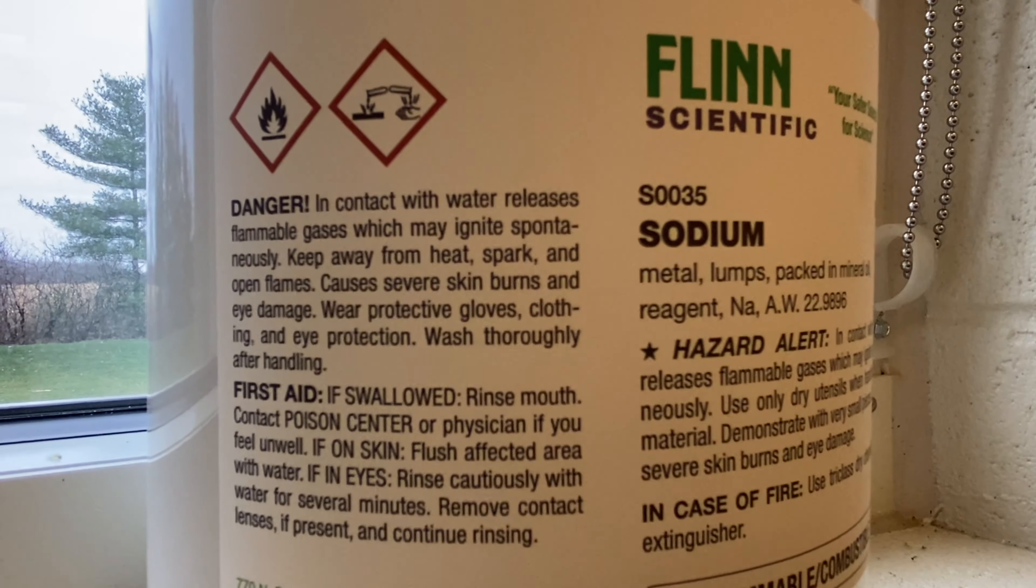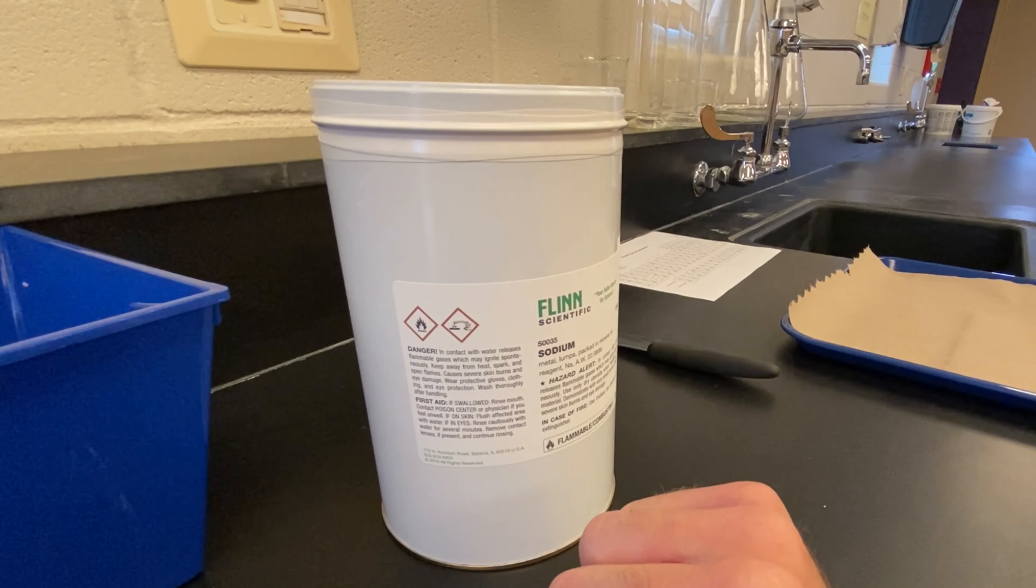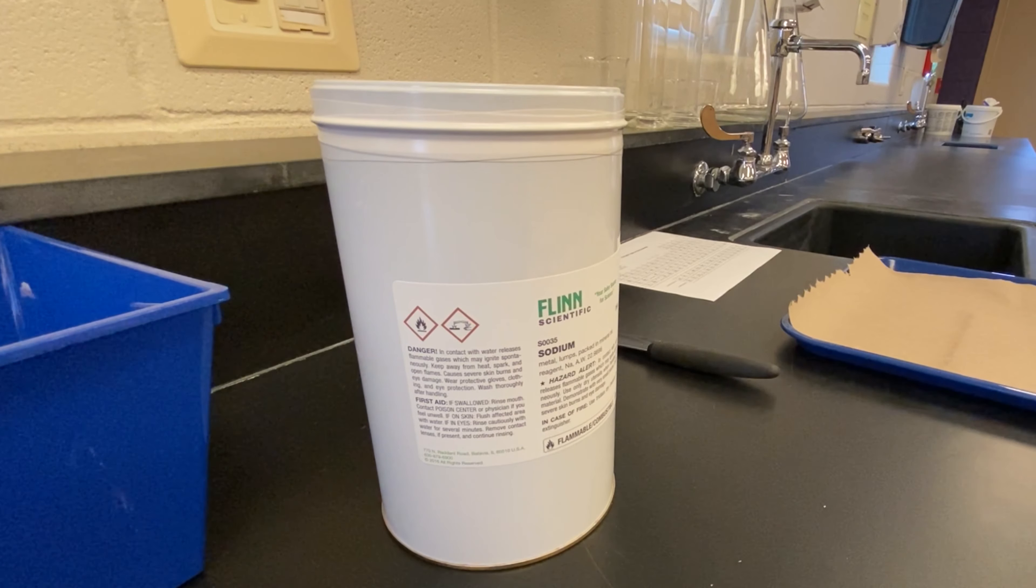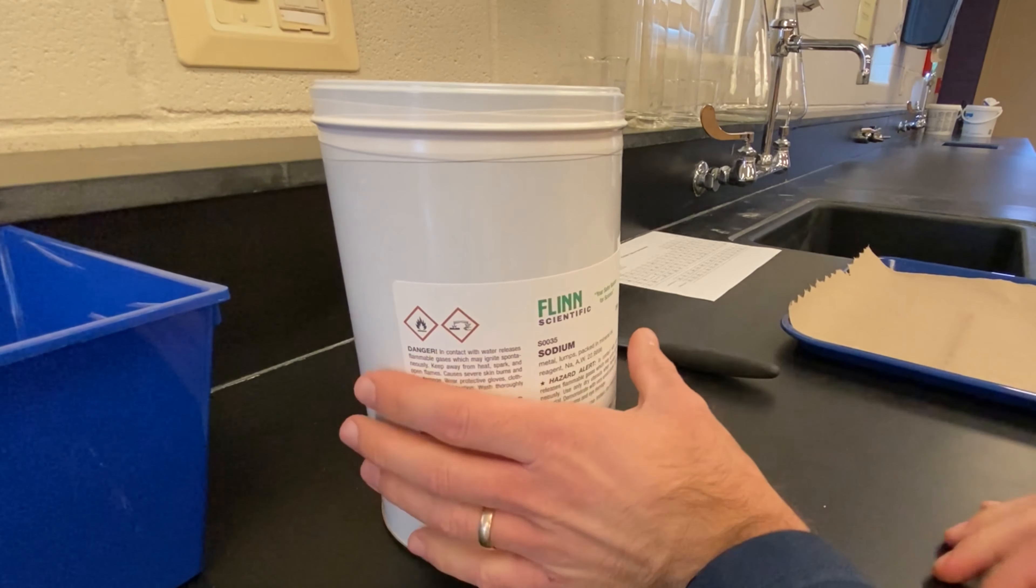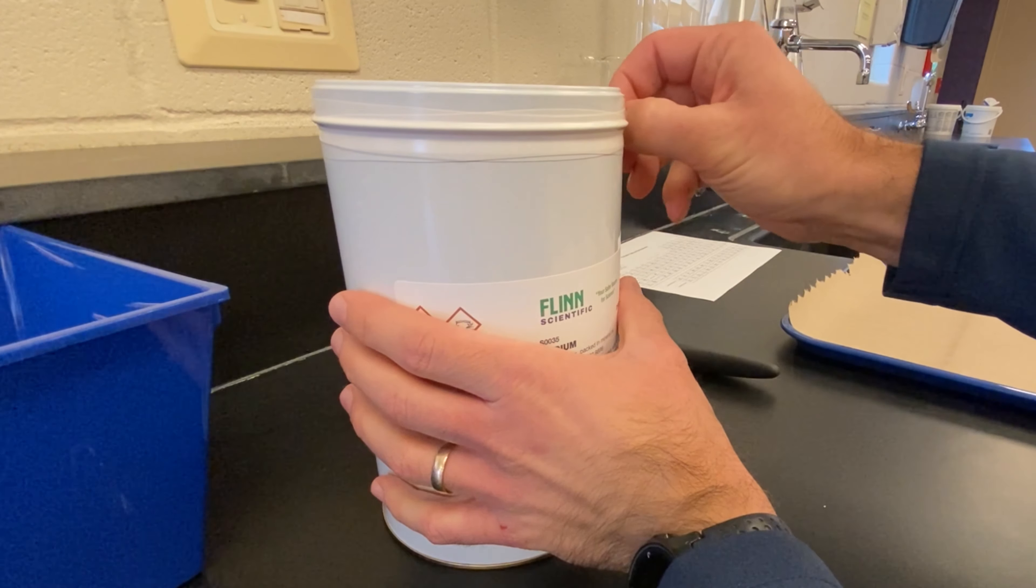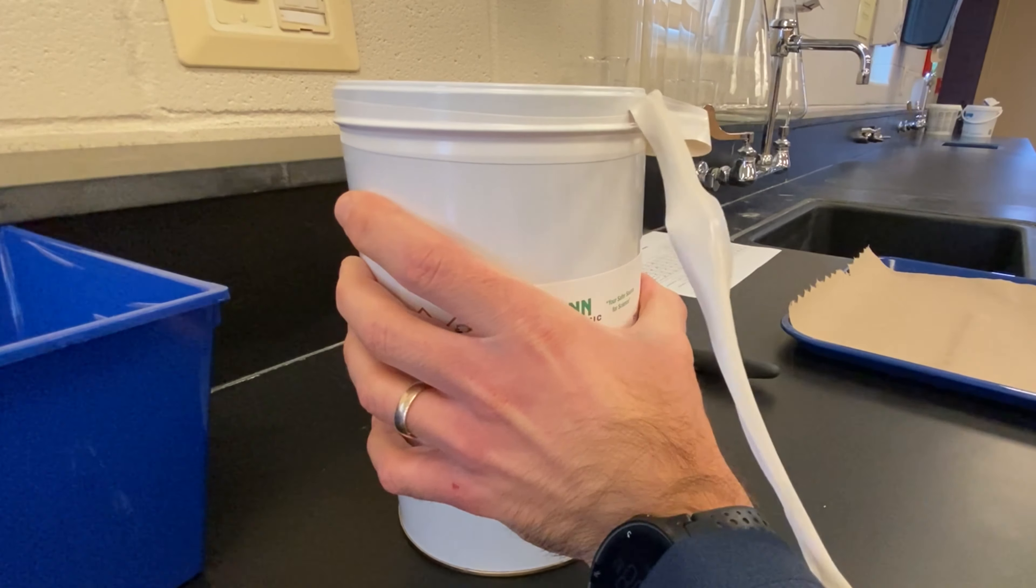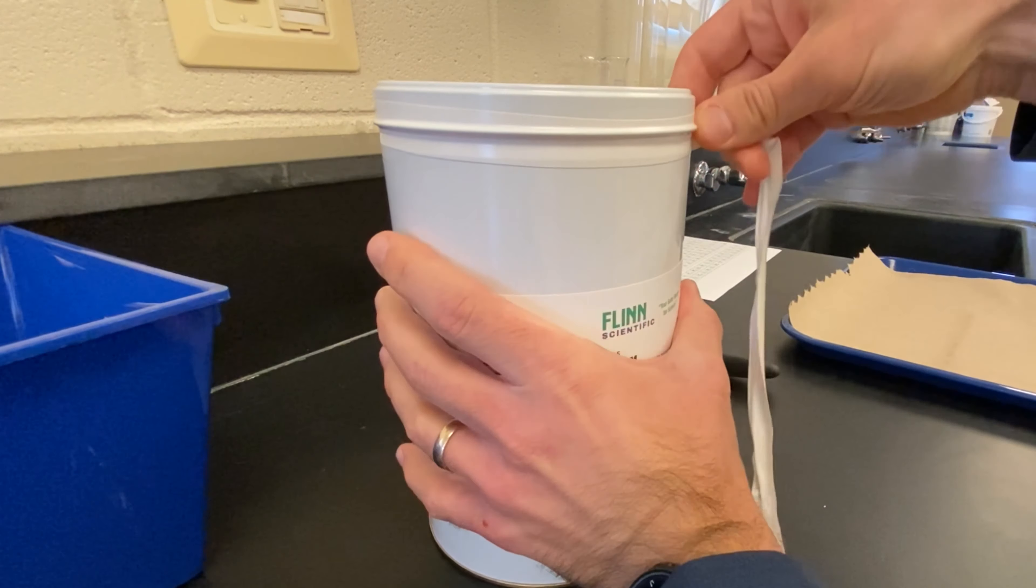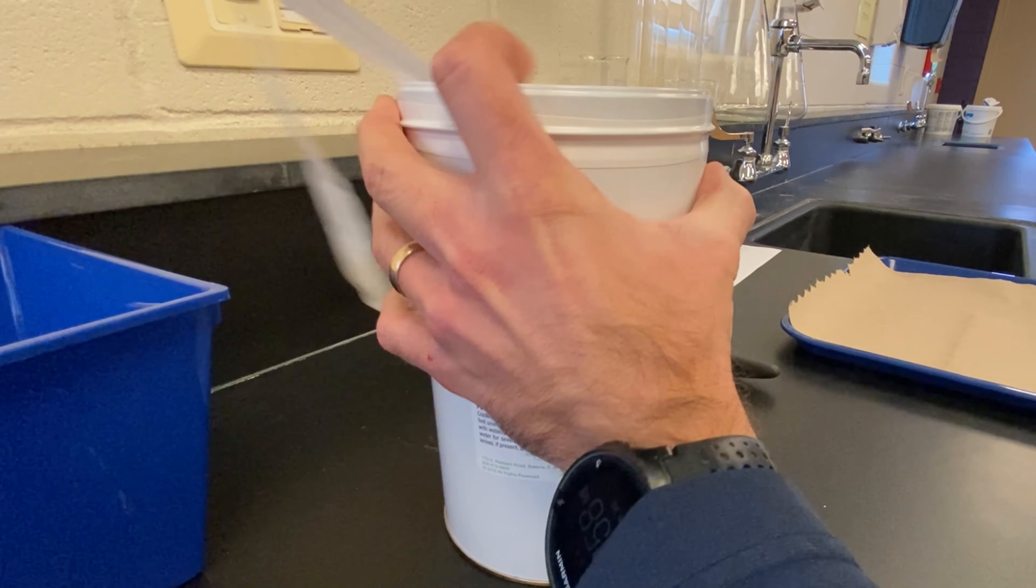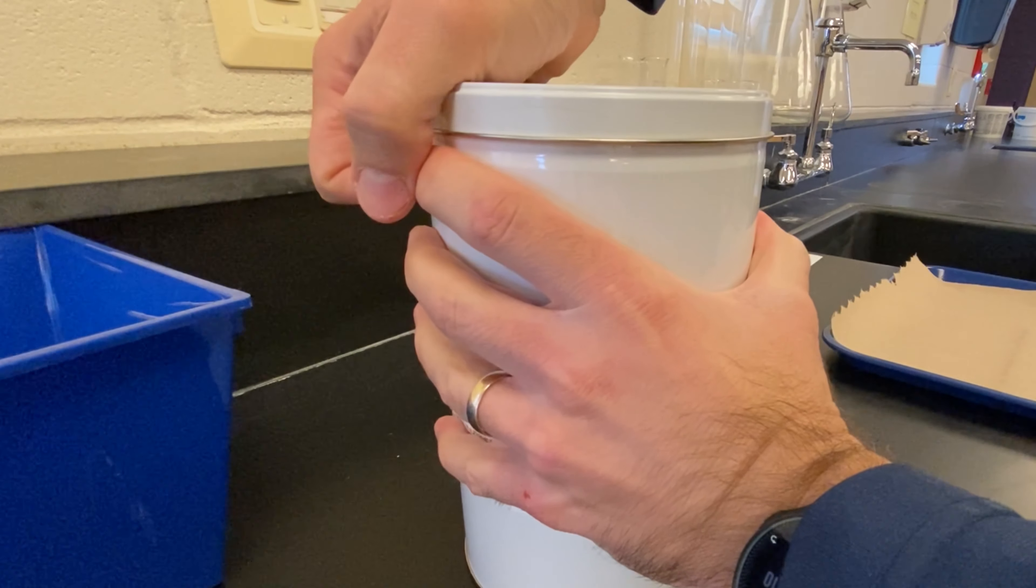There are some danger warnings, which I won't get into very much here, but right here we can see that it is flammable. It has flammable gases, spontaneous igniting, keep away from heat, spark, all that stuff. Probably would be smart to have my goggles on. And here's another sign that this stuff can be dangerous, and we need to be really careful in how we handle it, is check out how it's shipped.